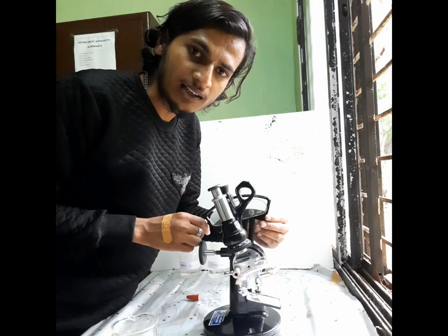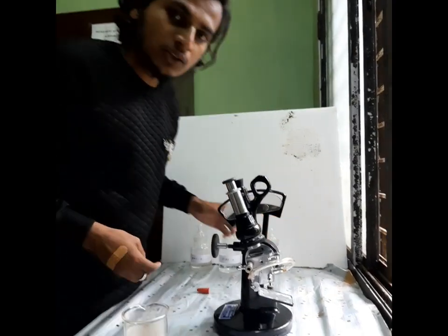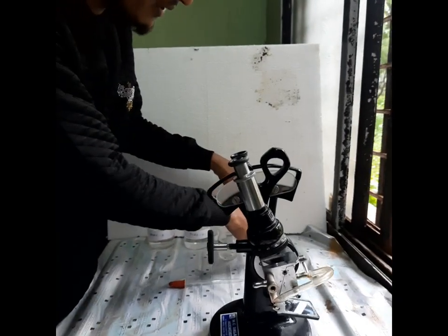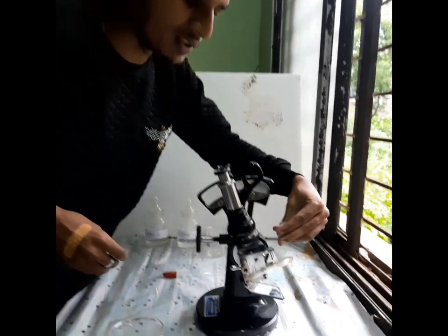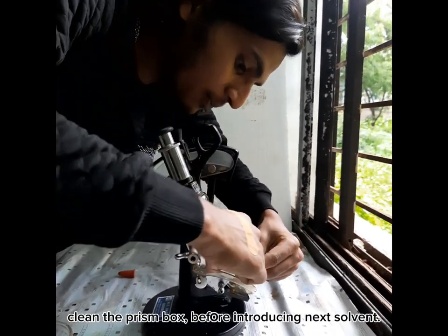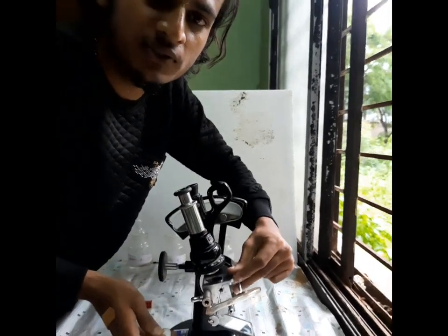After taking the reading for pure A solvent, we need to repeat this procedure for pure B as well as the unknown mixture. Before introducing pure B, we need to clean this surface by using acetone and then follow the procedure.